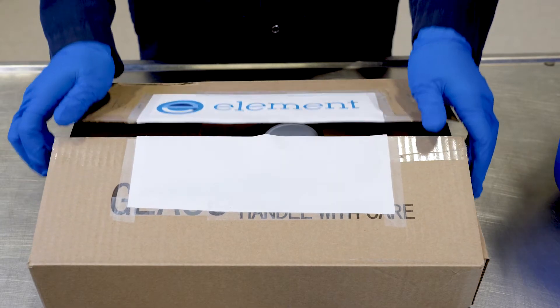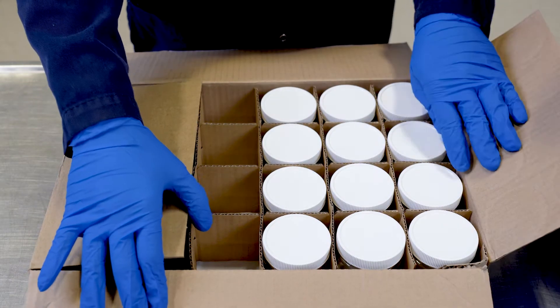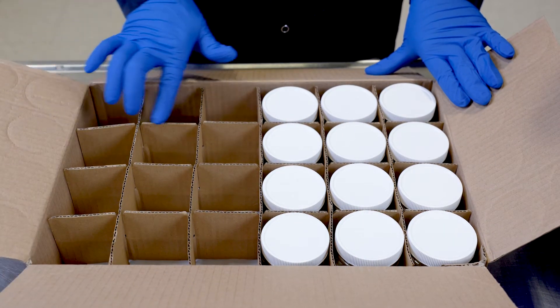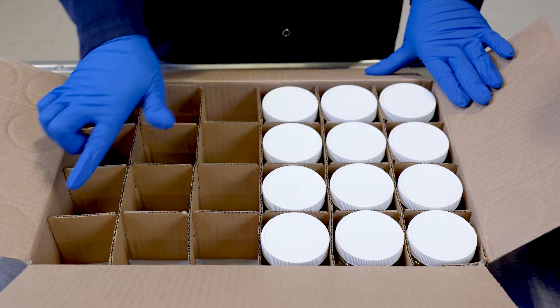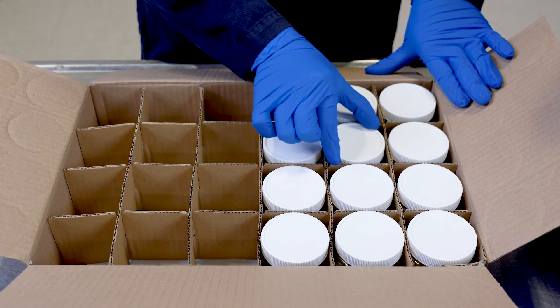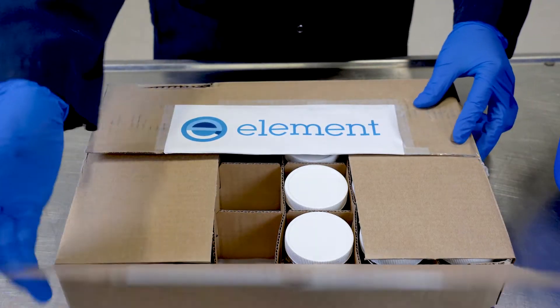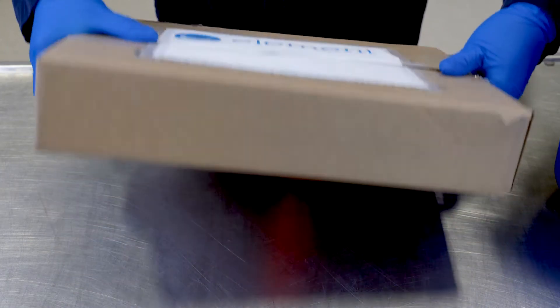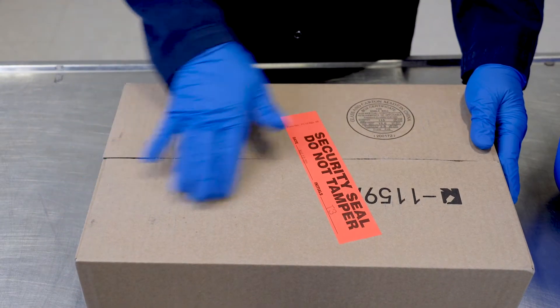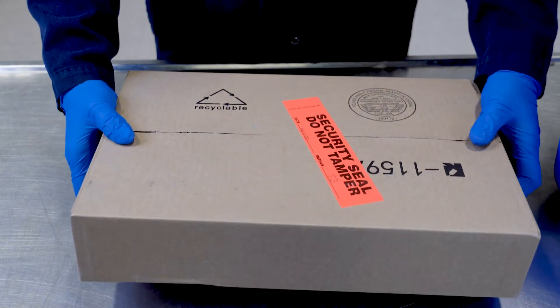In this case we have a half full box of jars. We recommend that you reuse the boxes that the jars were supplied to you in. The cardboard cutout pieces provide a buffer between individual containers so they don't hit each other during transport and cause a potential break. One consideration when using the boxes is to make sure there is no additional moisture at the bottom, as wet boxes can fall apart as the structural integrity degrades.